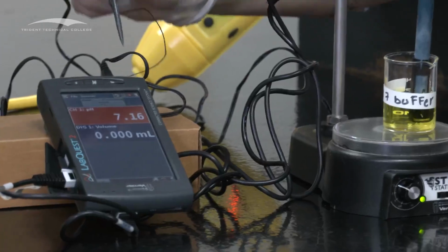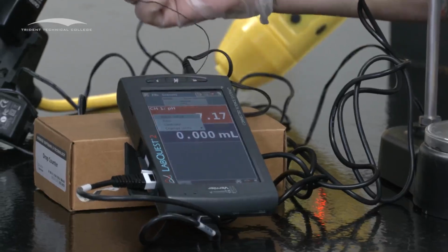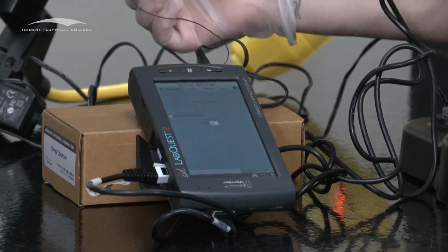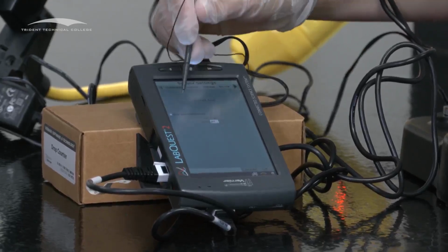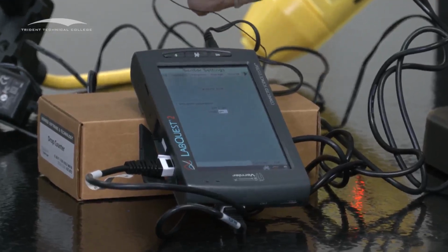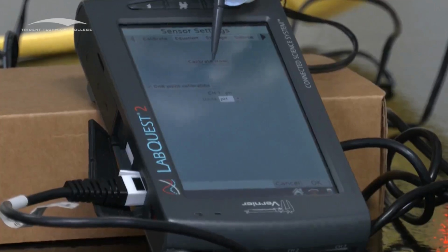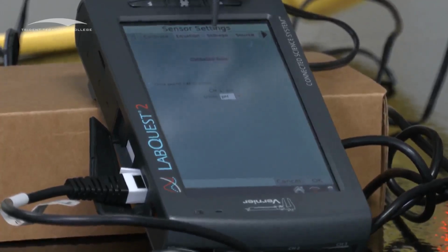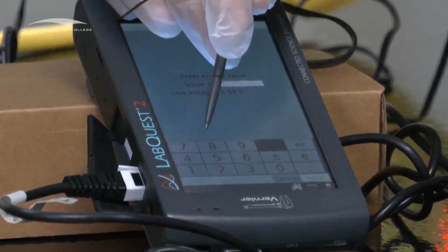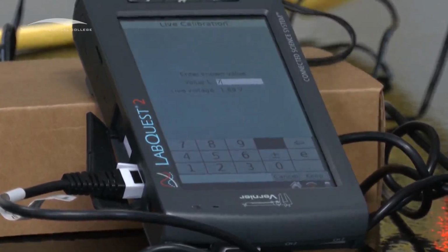and then I'm going to click on where it says pH, click on the red screen, and then you're going to hit calibrate. And then you're going to hit 1-point calibration, which on your screen should look a little bit bigger than this. Make sure that you hit 1-point calibration, then click calibrate now. It will ask you for a value, that is the value of your pH. So this is just 7, which is our neutral, and then we want to keep it.